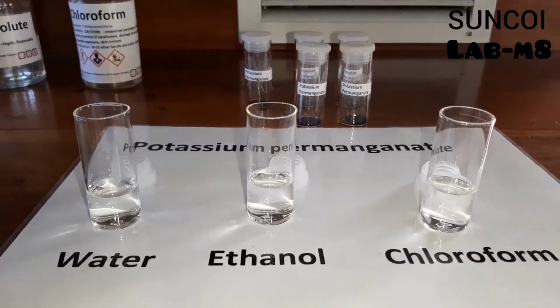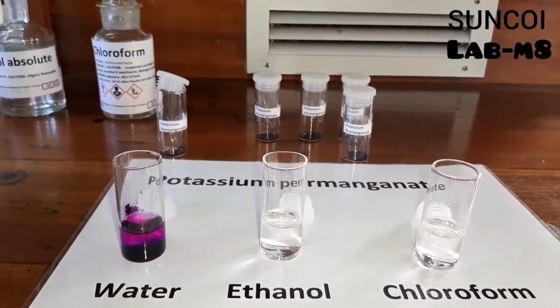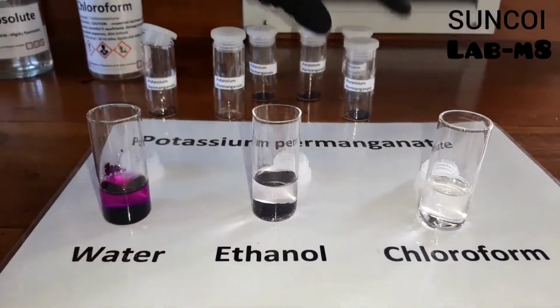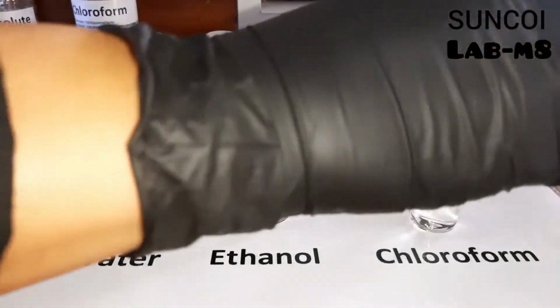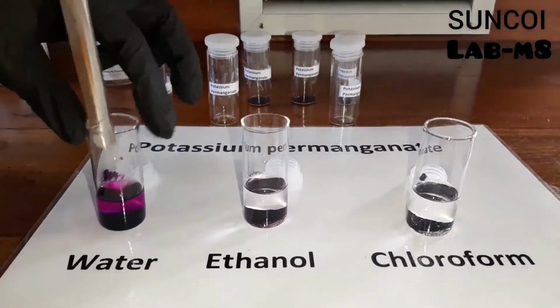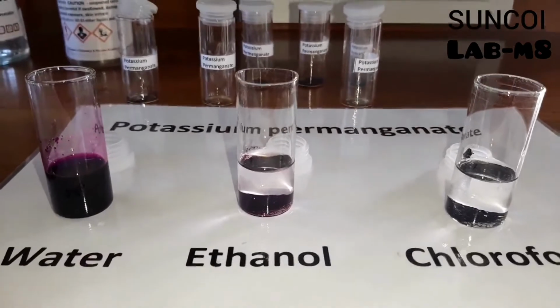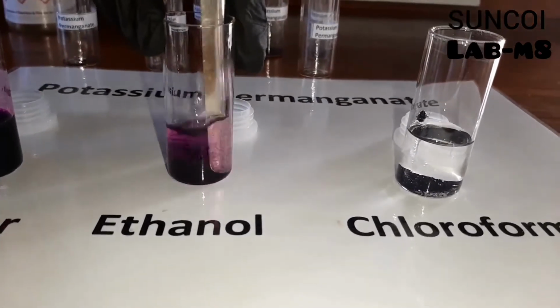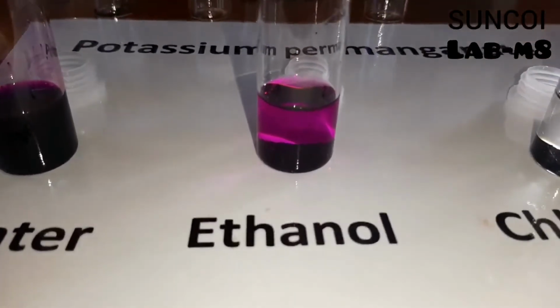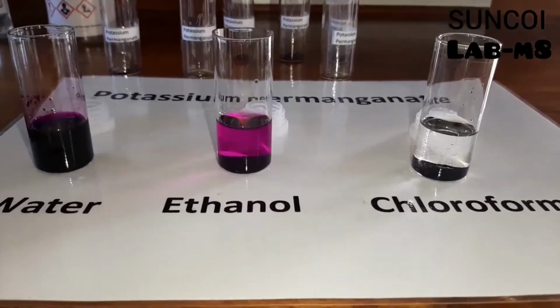So the last substance is potassium permanganate. And wow, immediately when you add it to water, do you see that beautiful color change? When you add it to ethanol, it looks like not much is happening. And when you add it to chloroform, it also looks like not much is happening. When we stir, we can see it's very clearly soluble in water. In ethanol, it seems like it's soluble, but is it? And then, of course, in chloroform, you stir and stir and stir, it just settles at the bottom.